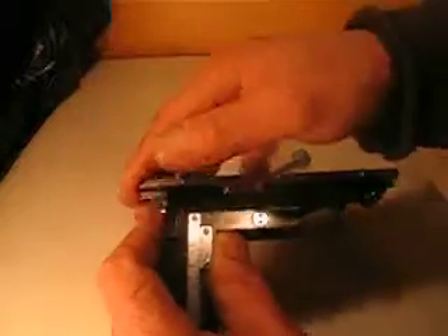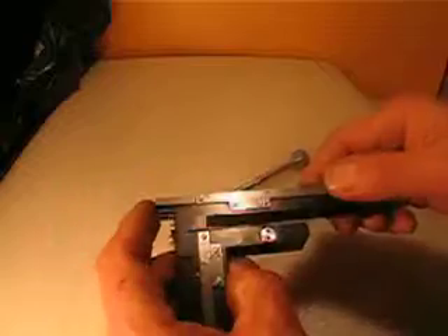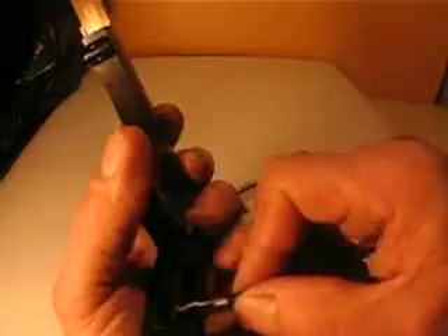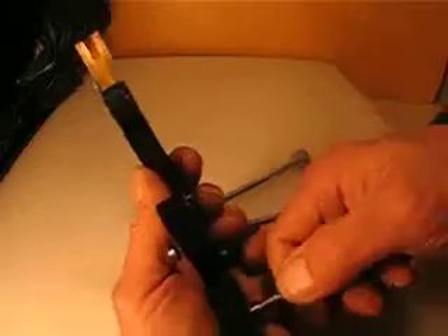This is the second video. I have another one that I take completely apart to figure out what happened with it. I just can't find out exactly how the ratchet works. Because if you push and pull this, you feel it's kind of stopping at some point. And those guys make very fine pieces.